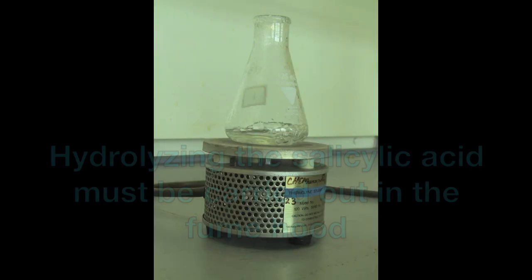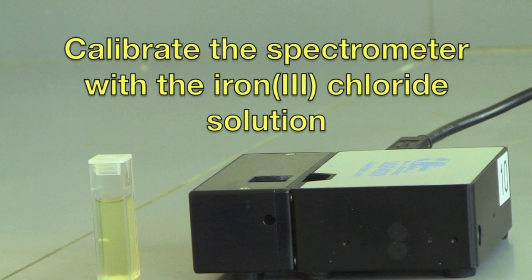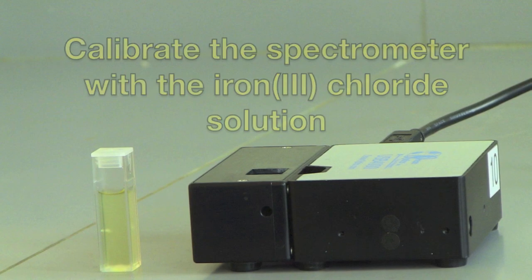Additionally, there are a few important things to remember in this experiment. Make sure to carry out the boiling reaction of the acetylsalicylic acid and the sodium hydroxide in the hood. Also, when calibrating the spectrometer, make sure to use iron 3 chloride as the solution which you calibrate with. As with any experiment, it is always important to follow directions. They are there for your own safety as well as your classmates.